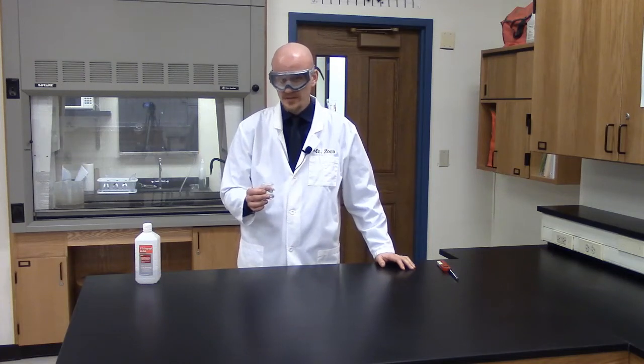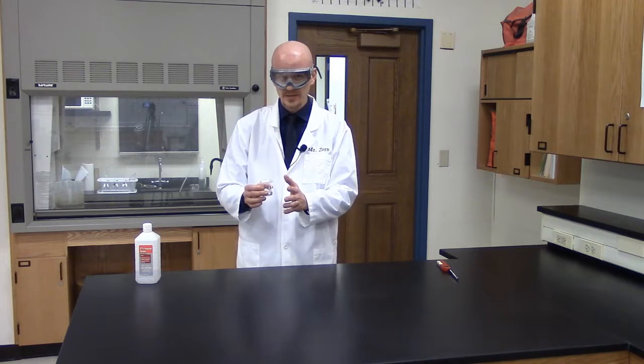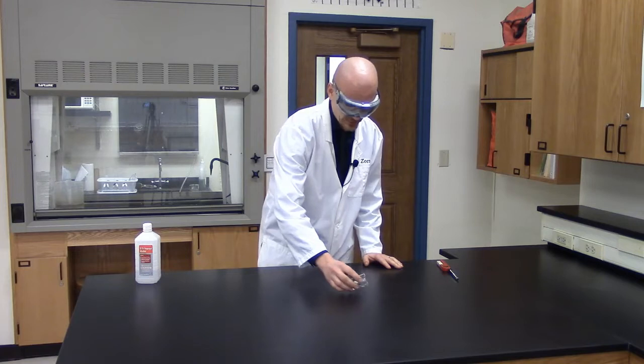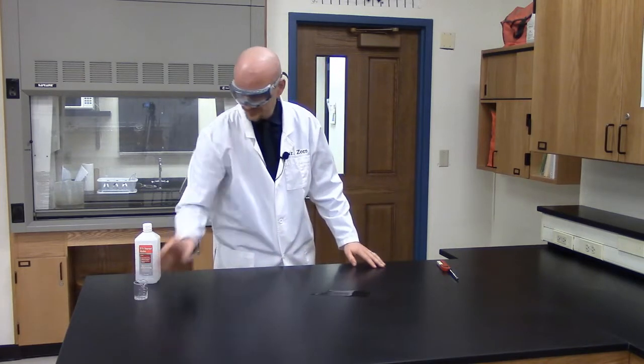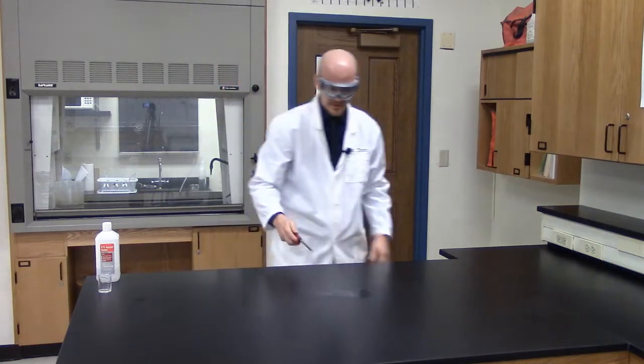So what do you think is going to run out first, the isopropyl alcohol, which will be acting like the fuel in this case, or the oxygen in the classroom? Let's find out. So I'm going to go ahead and pour this out on the lab table and let's light it on fire.